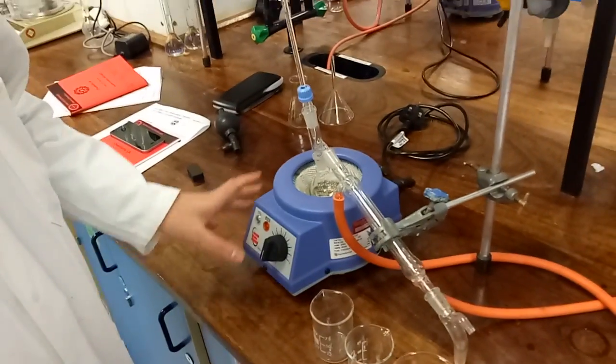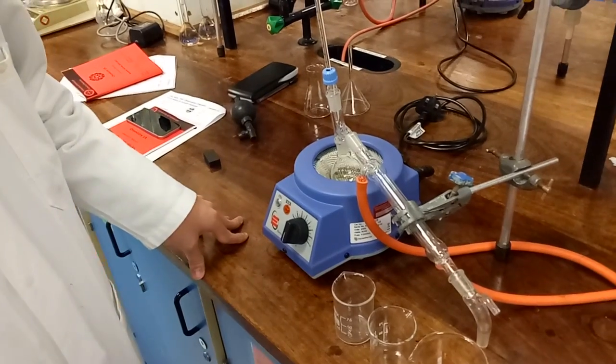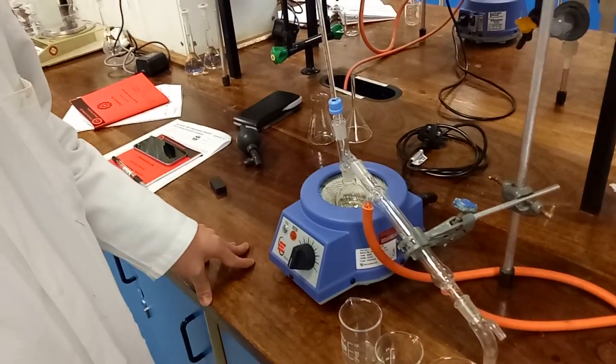Normally you would do this in a fume hood, but because I'm not doing anything, there's no need to set it up in a fume cupboard.